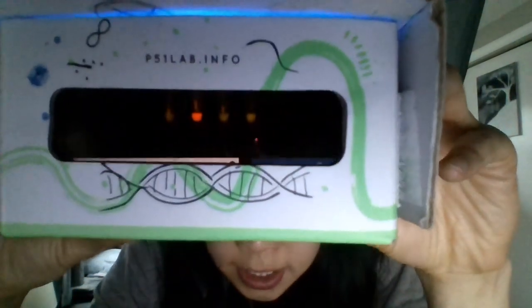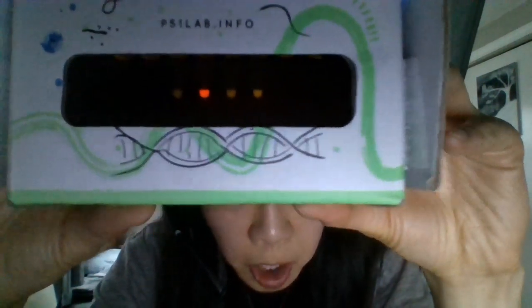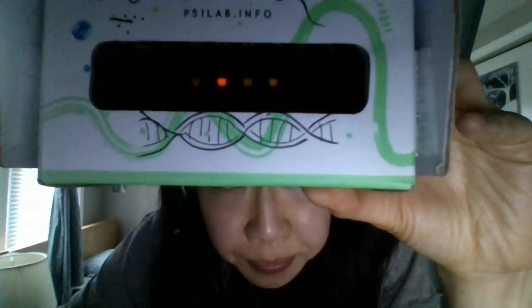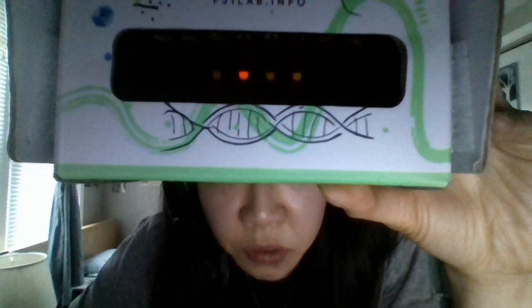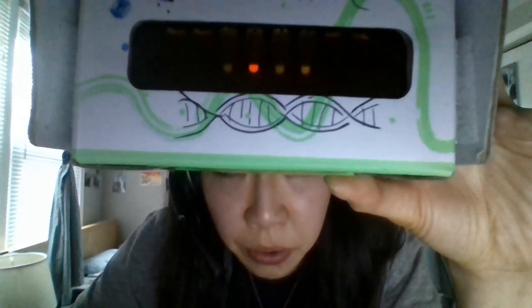So let me get this going, turn off my light again. I started these tubes yesterday, so these are the results that you see today. What we see here is that tube number 1 is still blank, tube 2 is red, and tubes 3 and 4 are blank. In the case of tube 2, since we see red, it must mean we have the red fluorescent protein that I just talked about, and that translation was successful. Alright, lights back on.